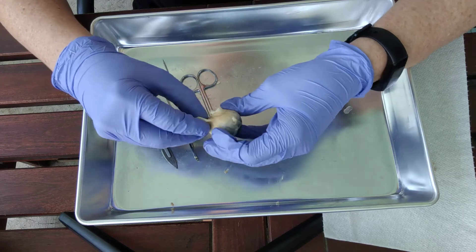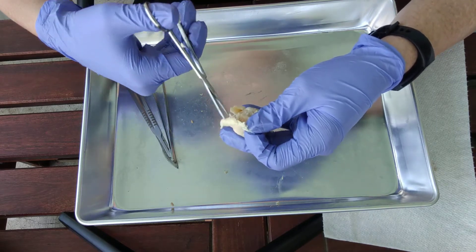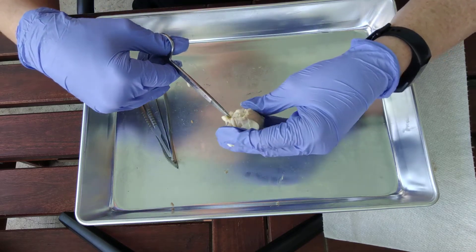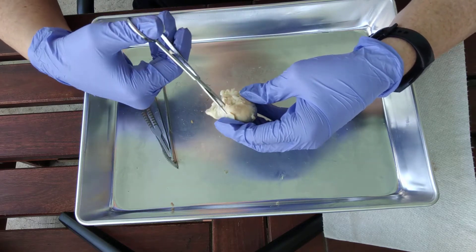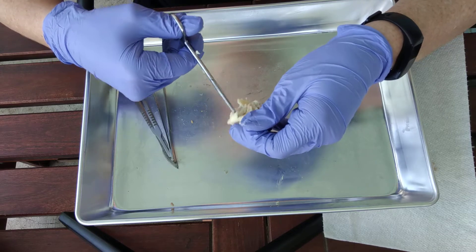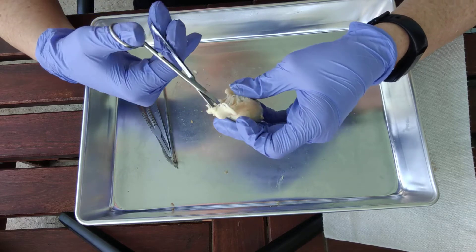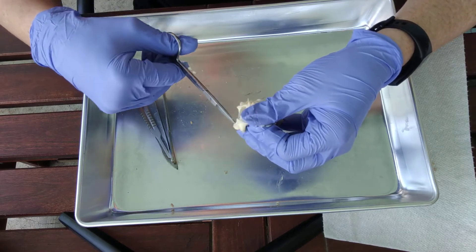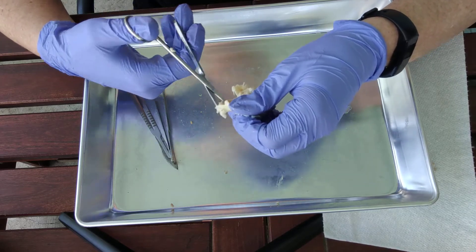We're going to go ahead and try to get some of this fat off. We don't need to remove every single piece of fat, but we want to remove some. You don't want to just go cutting things because the other thing I want to find is some of the extrinsic eye muscles. You really want to focus on understanding and looking for differences in texture. The loose adipose connective tissue is going to be dispersed and lumpy. If you see structures with a distinctive striped appearance or a different texture, that is going to be the extrinsic eye muscle, and we want to try to keep that.